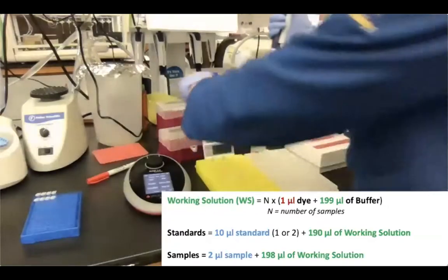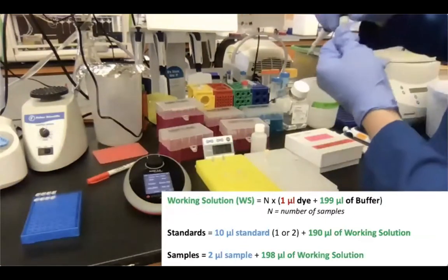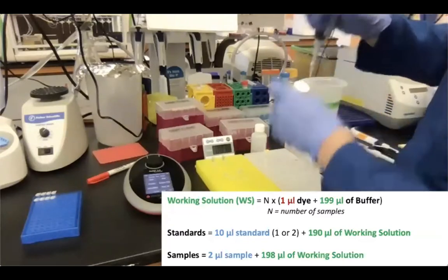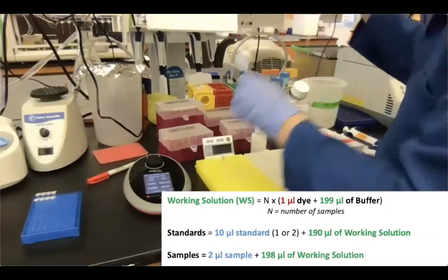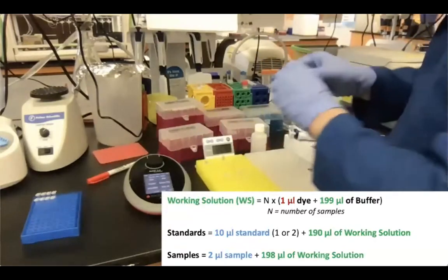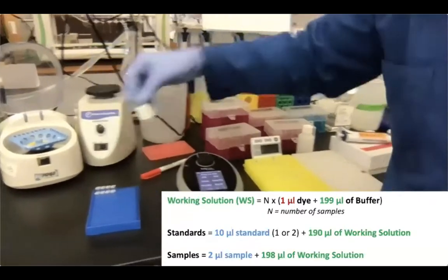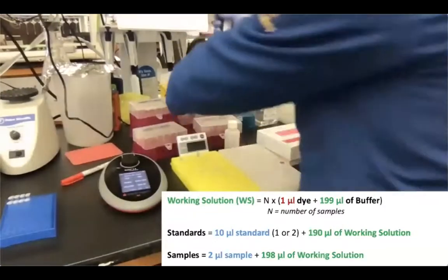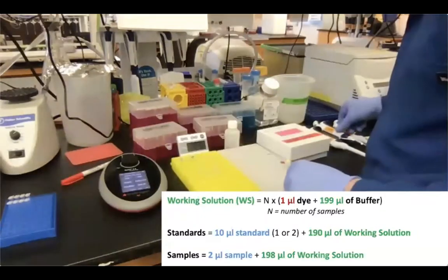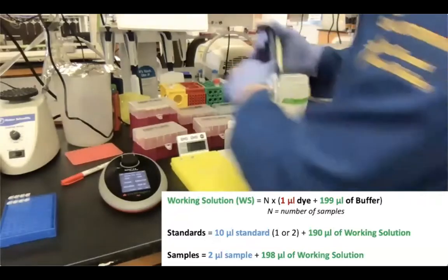Just gonna pipette the standards. We have standard 1. So standard 1 is basically blank. So there's no DNA, just the TE buffer. So it's gonna be our blank control. And then standard 2 is actually a defined concentration of DNA. Now we are pipetting 2 microliters of each of our DNA in there.